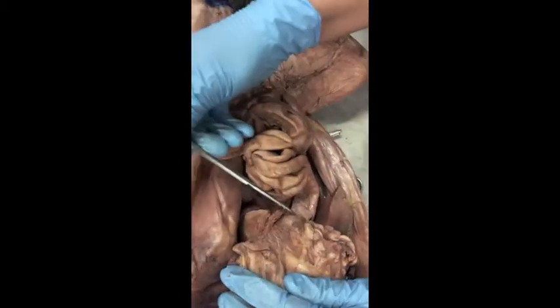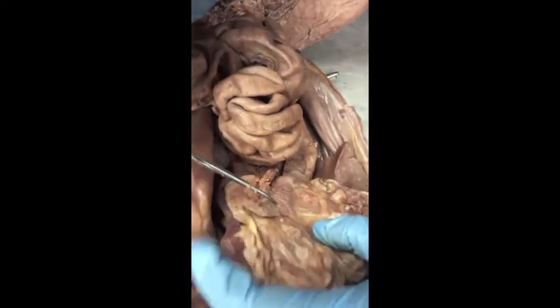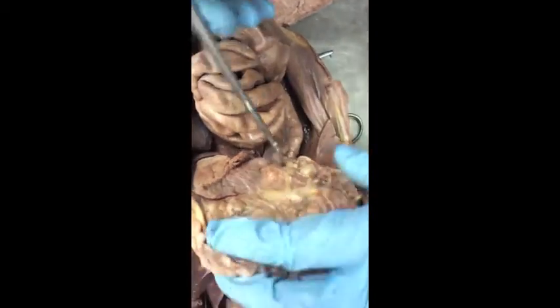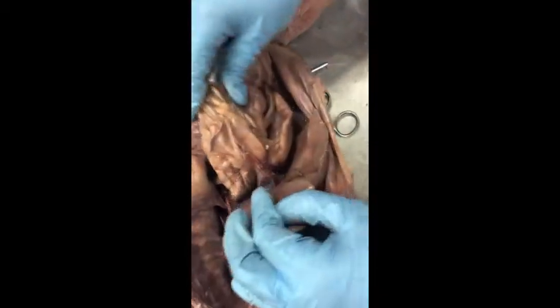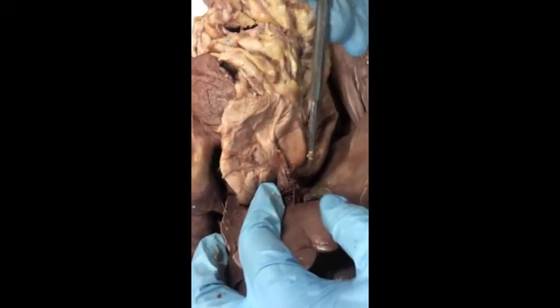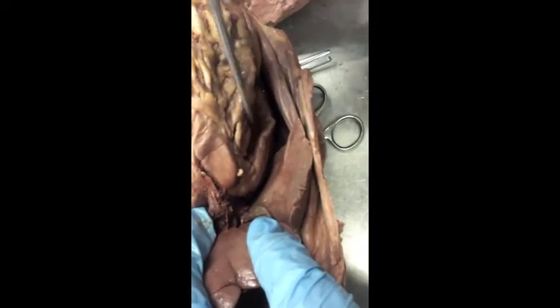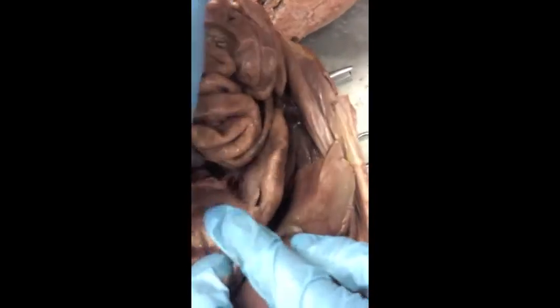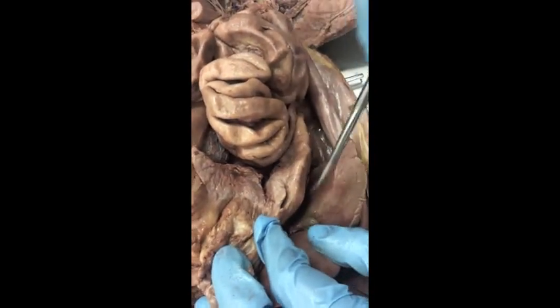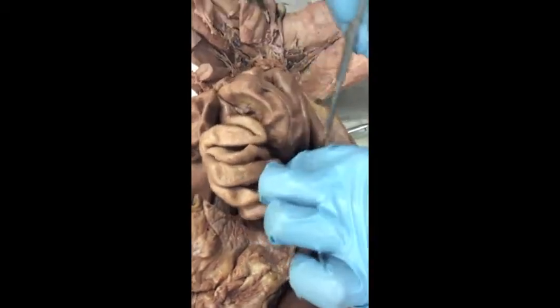If we reflect this back, right, we can see the pancreas, and the pancreas is going to extend all the way across until it connects ultimately up to the spleen. And the pancreas originates out of the curve of the duodenum. So if we look at our stomach, right, and we follow it around, here's the curve that is the duodenum. And then we can see, if we look up under here, here's the pancreas originating right within that curve. Right? And then the duodenum is going to give rise to the jejunum, which is going to coil about in here and ultimately become the ileum.